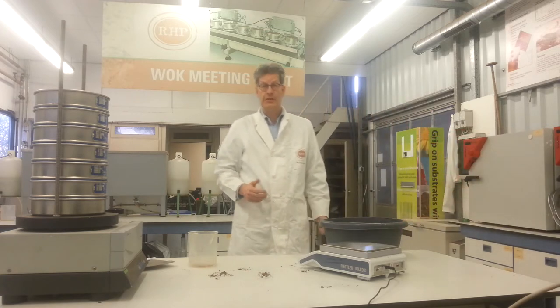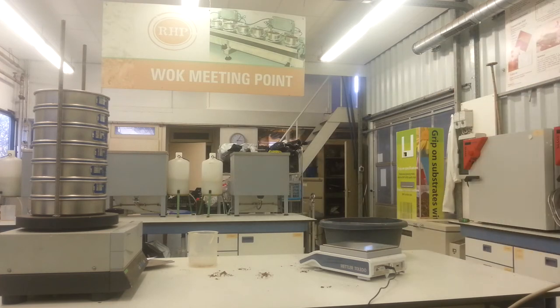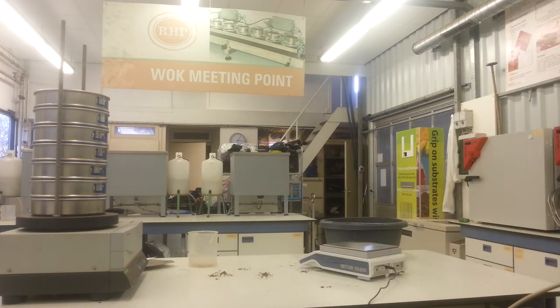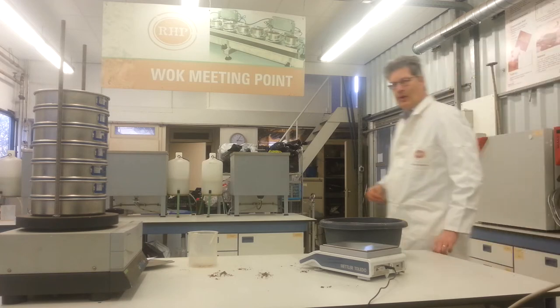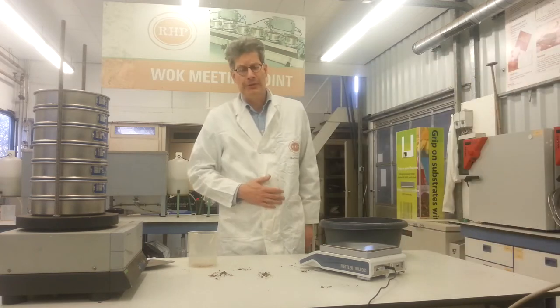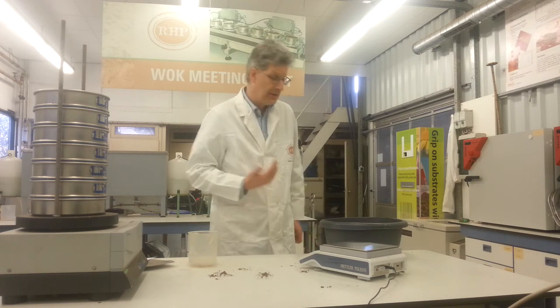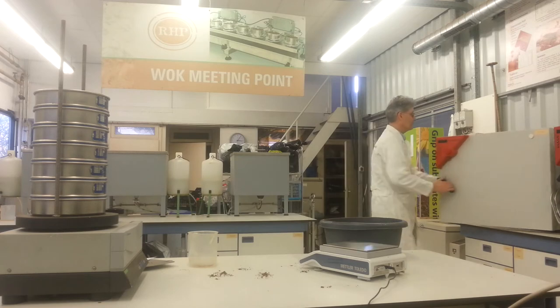Okay, see you in 72 hours. Well, as for demonstration, I do not wait 72 hours. So we go on with this material, pretending it's air dried. Take it out of the stove.